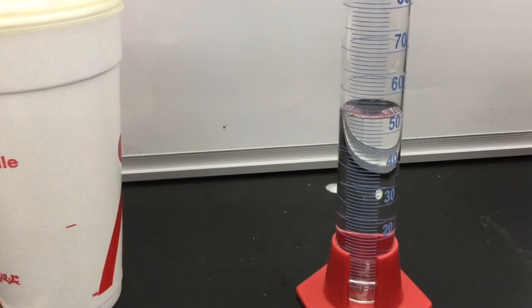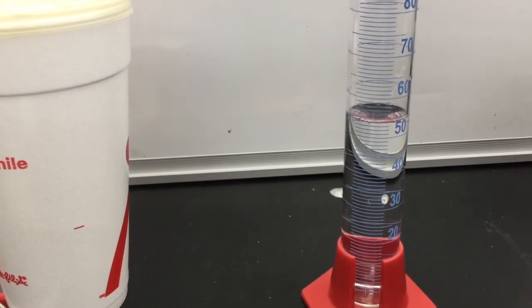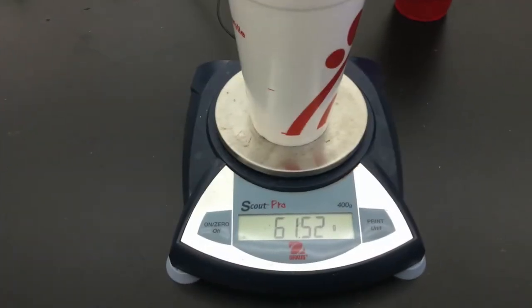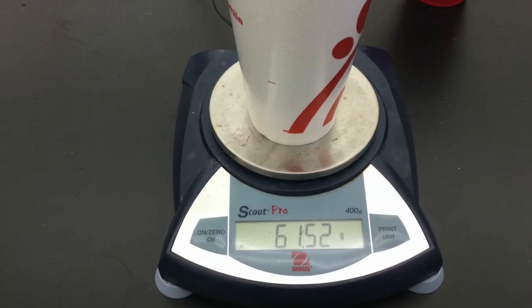Only use about 50 milliliters. This will allow for a greater temperature change and allow you to maintain more significant figures. Then re-weigh the cup with a lid so that you can determine the mass of the water that you have added.